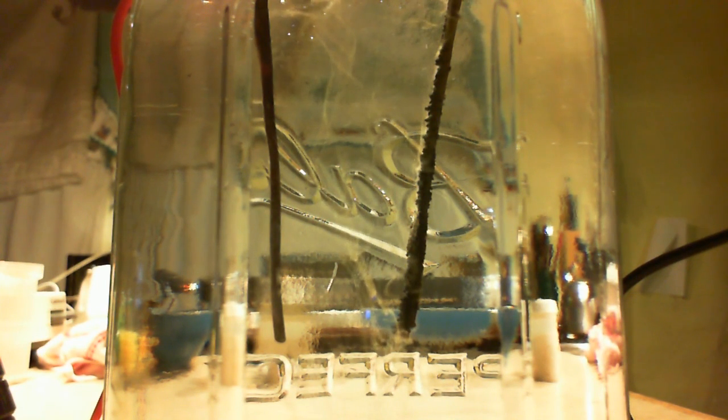Okay, here is a little bit further along. As the silver builds up in the water, the reaction happens faster. The black one, you can take that out carefully and wipe it off with a clean paper towel if you want to. Just rub it out - it's real soft. This is using the laser. You see how you can see the beam in the water? That's the silver particles reflected.